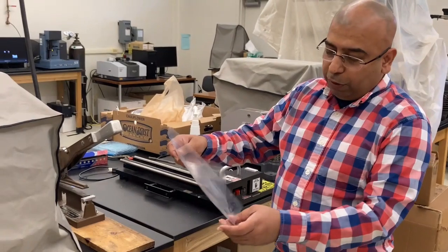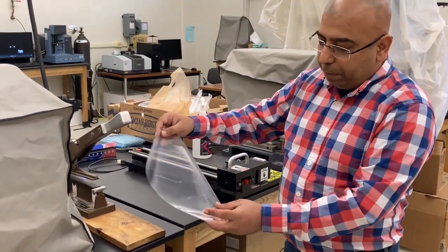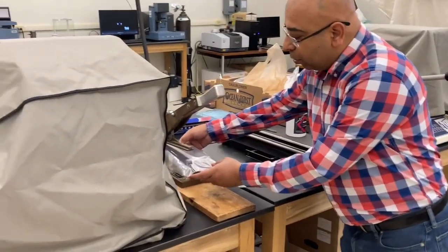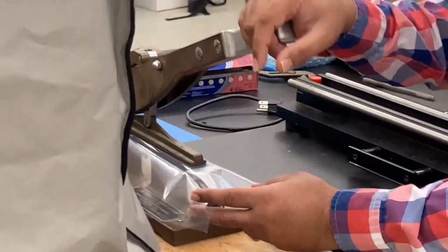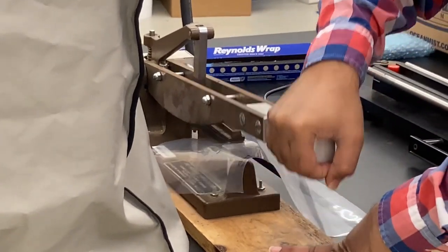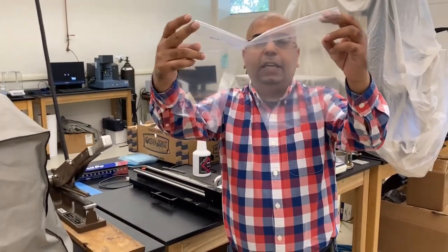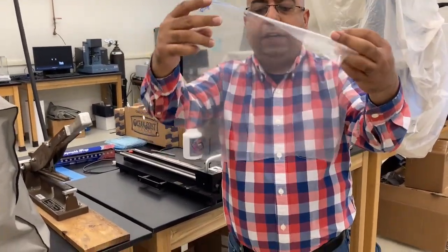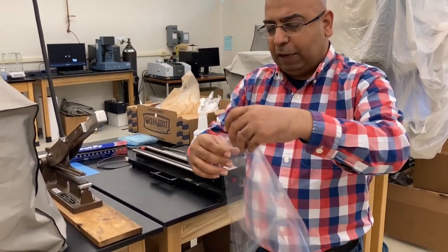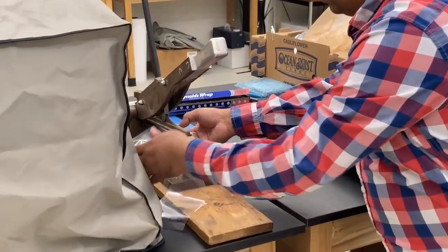cut the sample. Now we have different directions, machine direction and cross direction. So remember to always mark which direction you're cutting your sample in. This is my cross direction, so I'm cutting a sample first in the cross direction. I have this strip which is already cut, so I can easily separate it with the help of scissors. Before I do it, I want to take advantage and also cut in the other direction as well, so I don't have to come back right here again.